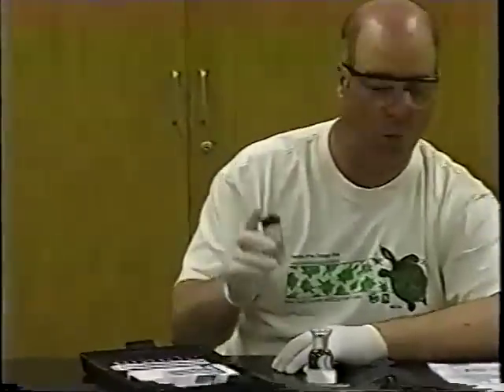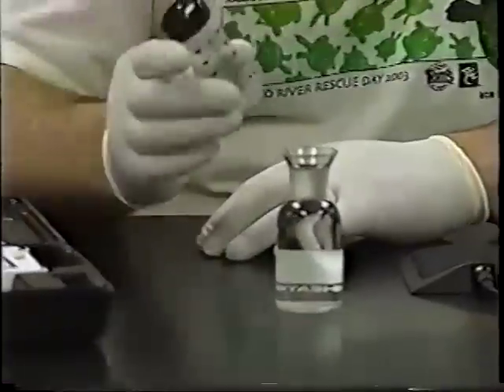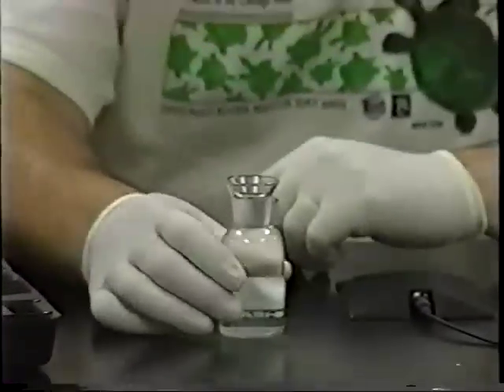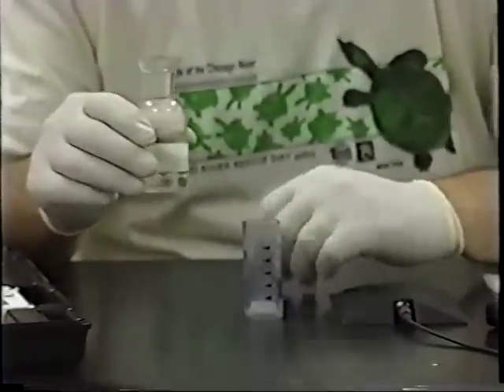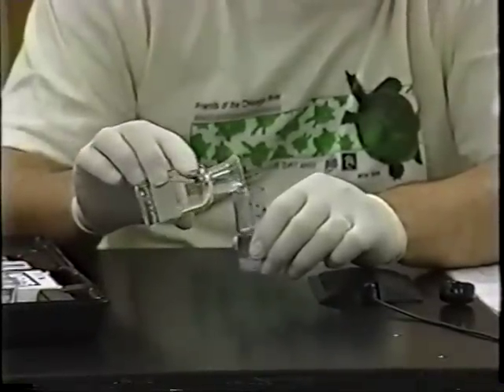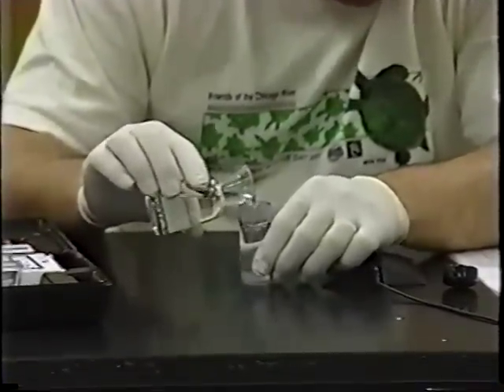The first thing you're going to do, once you've watched the video, is practice this once in class using water from the fish tank, so that you've run through the experiment and know what to do before you get out there. Inside the test kit is a little container that holds the water you're going to need. The first step says to fill the sample cup to the 25 milliliter mark with your collected water sample. Here's my little bottle that I used to collect water from the river, and I'm going to fill that up to the 25 milliliter mark.